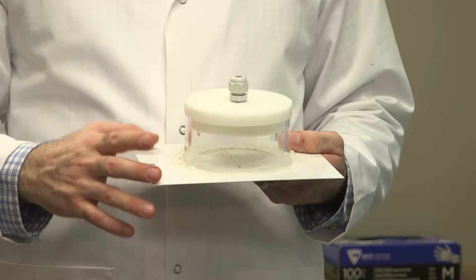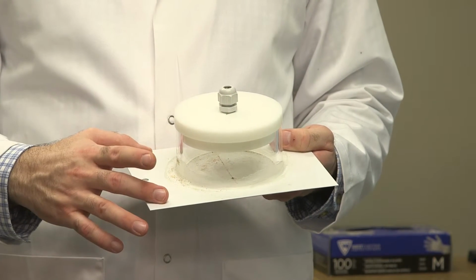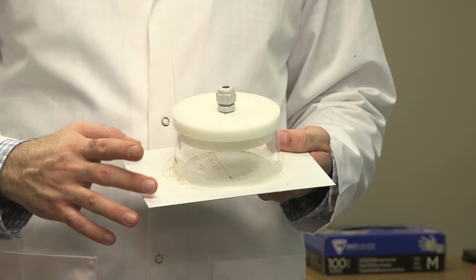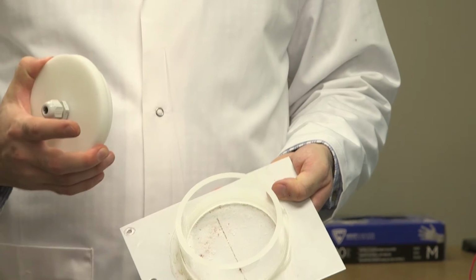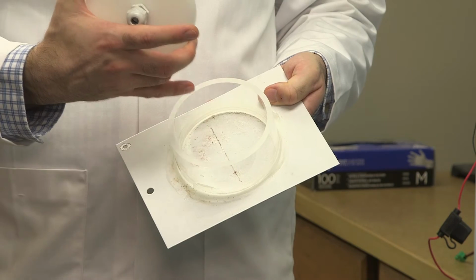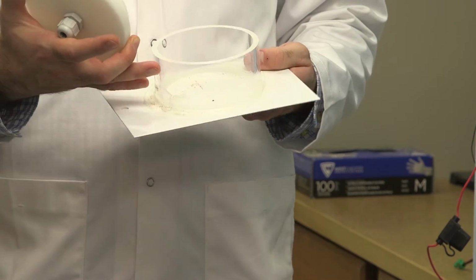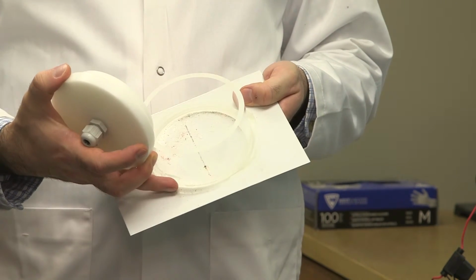These are the samples that are used in the static electrolyte experiments, and it starts with a plate of the material, just the same kind that we use in the Q fogs. In this case, it's galvanized steel that has been scribed using the Dremel tool as described in the segment on the panel prep room. And in this case, we attach a cell that's made out of acrylic, and it is glued with a bead of silicone.